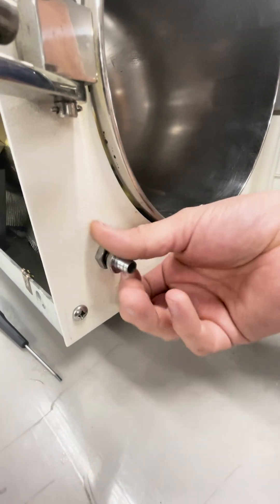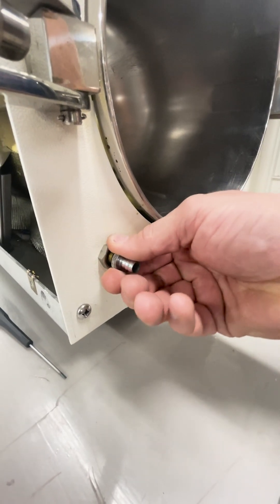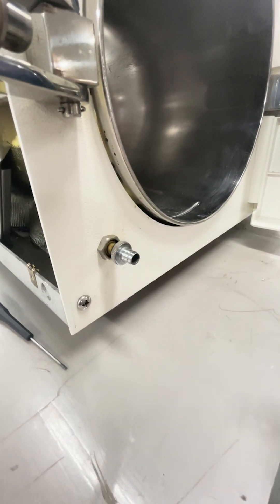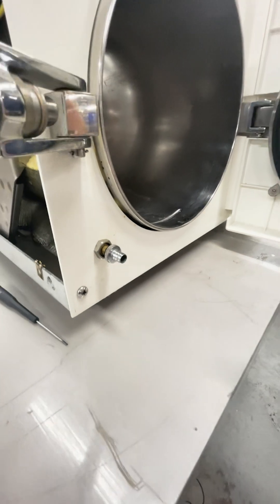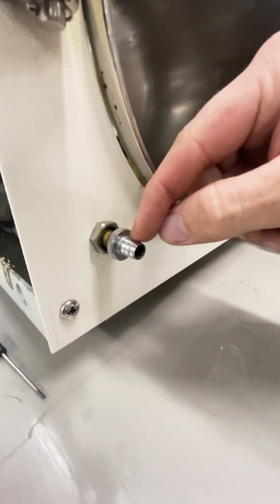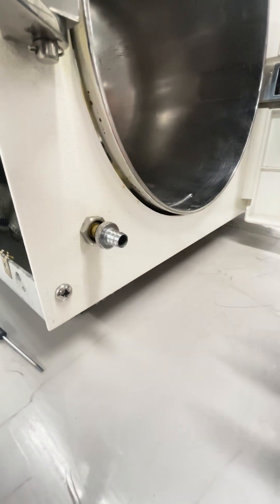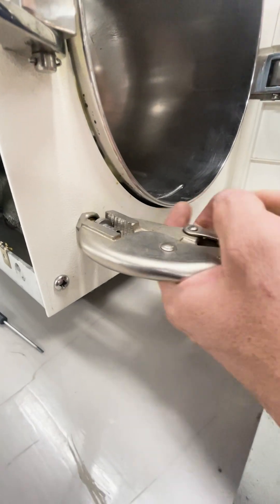I'm going to twist that off. When they get stuck like this and they're fully twisted out, you can use a pair of pliers. You want to make sure that when you grab, you're grabbing on the thick part and not on the hollow thin part, because it will thin out.